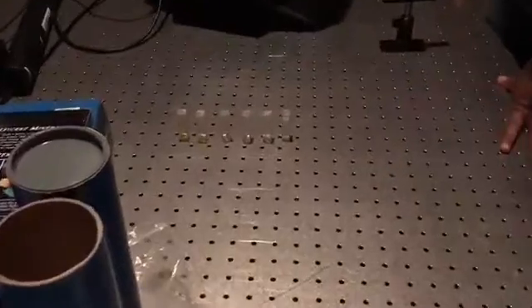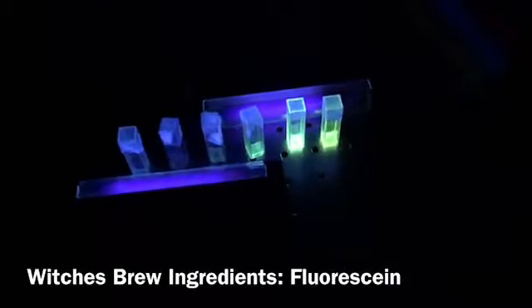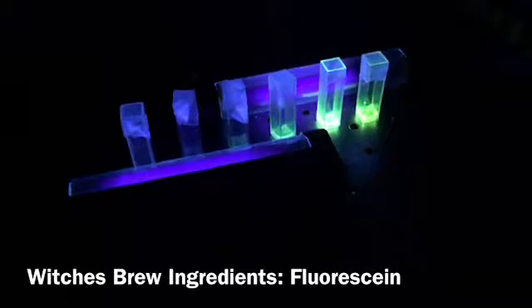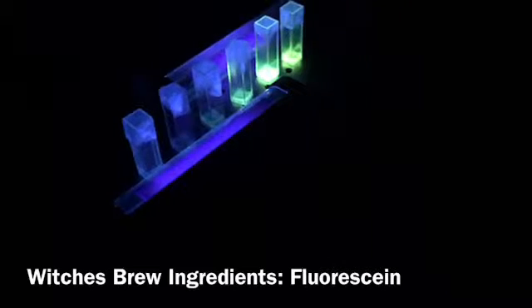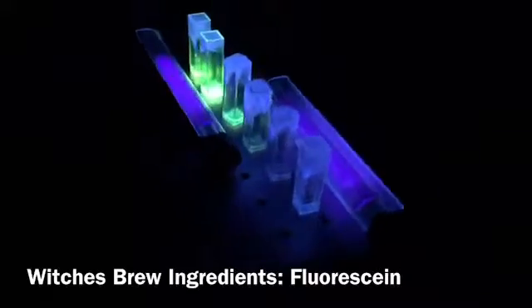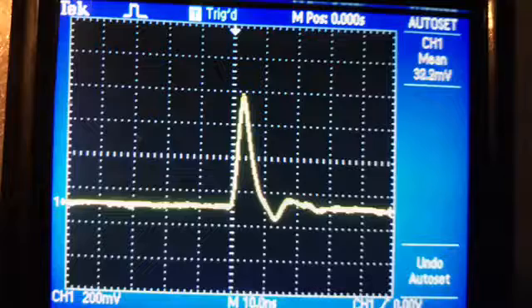One significant result that we took away from this lab was an analysis of the fluorescence of our TA's witch's brew. Here we can see that different concentrations of our TA's witch's brew fluoresce at different amounts. It would seem that the concentration of 0.00001 doesn't fluoresce, but the concentration of 0.01 is the one that fluoresces the maximum. Here we can see on an oscilloscope the decay lifetime of a fluorescent sample. The lifetime can be calculated from this curve as taking the maximum and dividing it by e and finding the time that corresponds to this value.